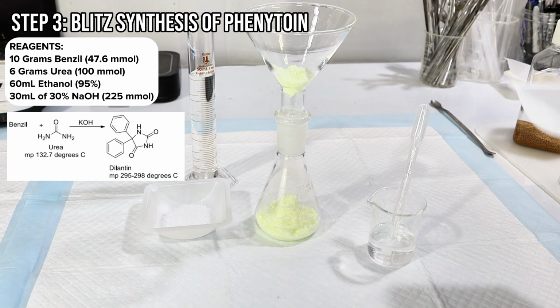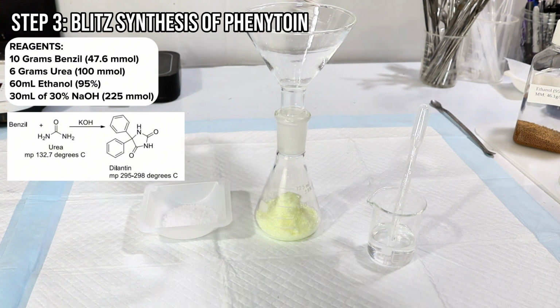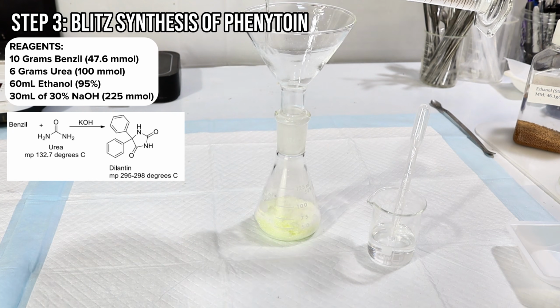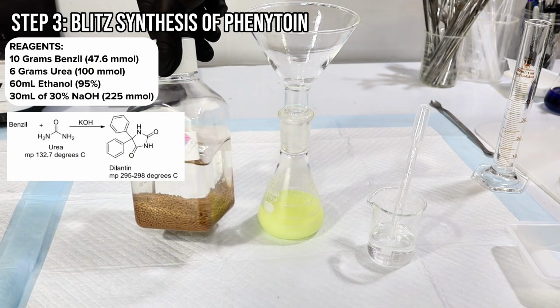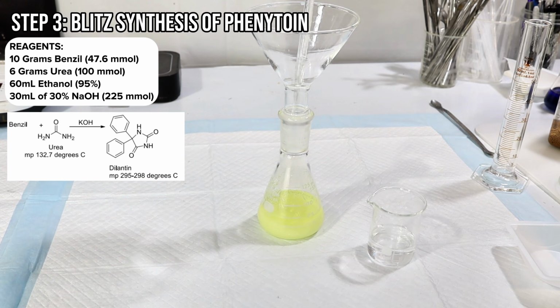To get started, I began by adding 10 grams of my Benzil to a 125 milliliter flask and set the rest aside for a different project. I then added 6 grams of urea, 60 milliliters of ethanol, and 30 milliliters of 30% sodium hydroxide. I added the sodium hydroxide last, and as you can see, the moment the sodium hydroxide is added, the mixture turns a distinct purple color.